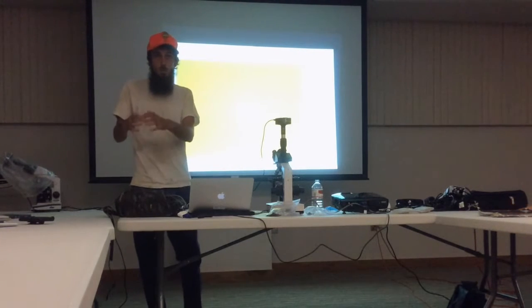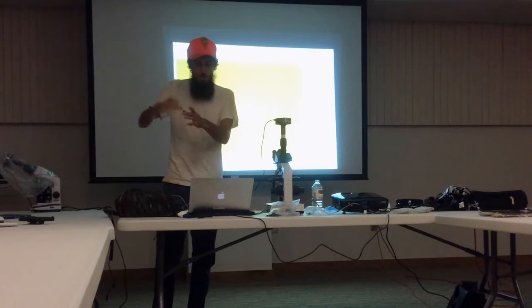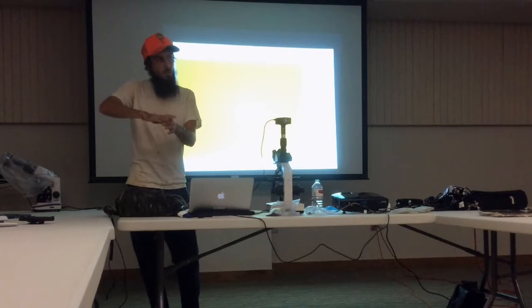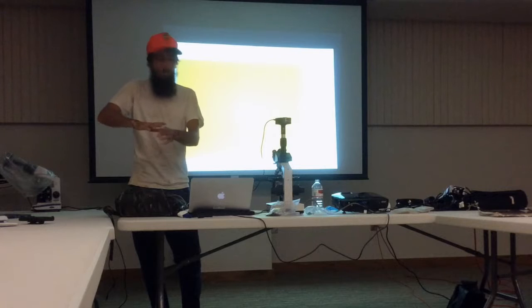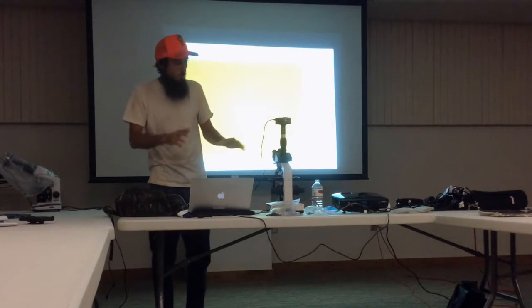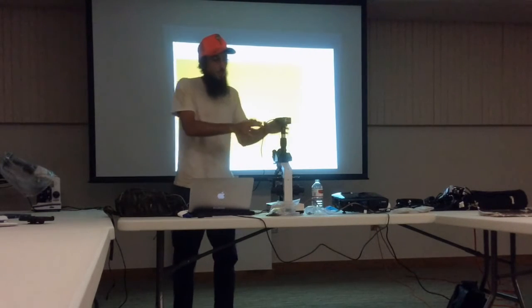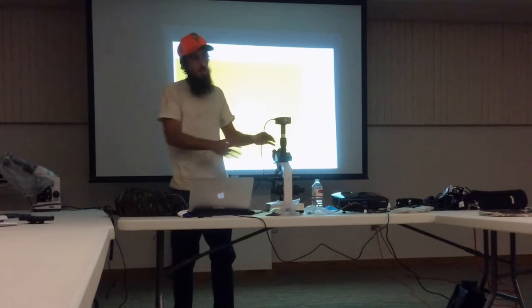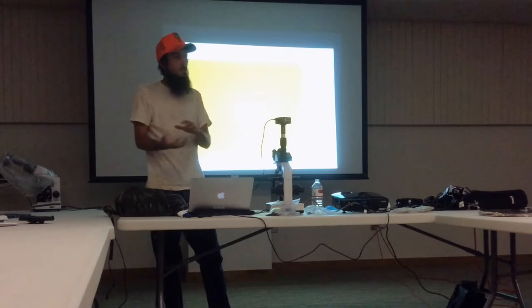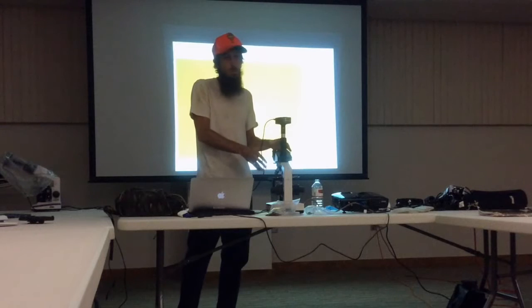So in microbiology, you take the sample, you put it on a plate of stuff, and it grows, right? When you put the lid on top and you cut off the oxygen, only stuff without oxygen is going to grow. With this microscope, you can see stuff that grows in the soil and stuff that grows with oxygen. So using this live method versus trying to plate to see what's going to grow gives you much more of an idea what's happening in the soil.